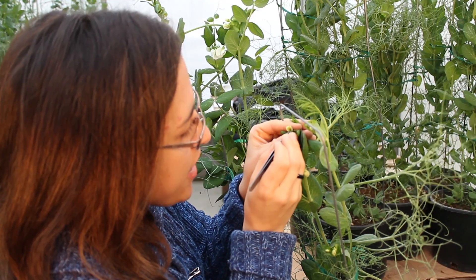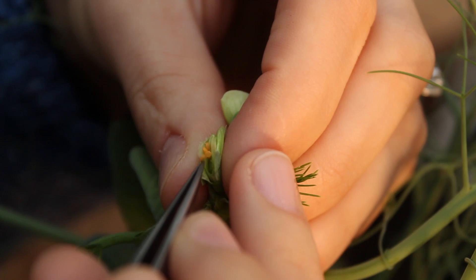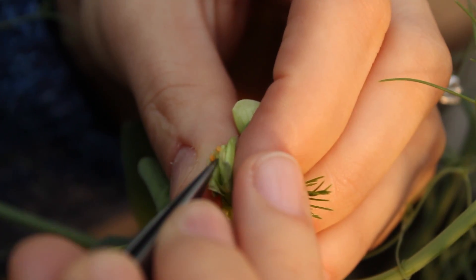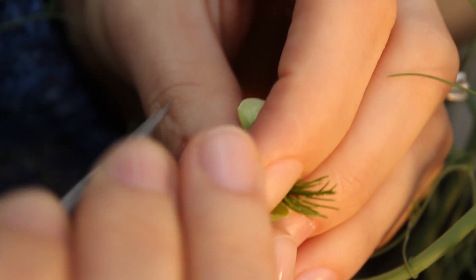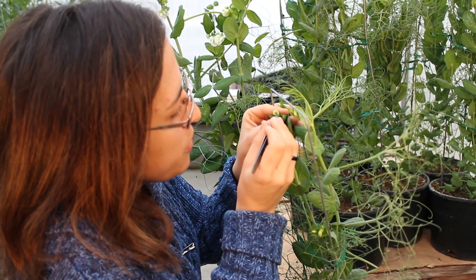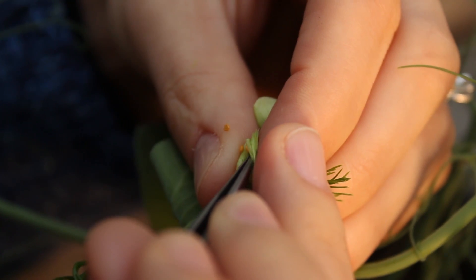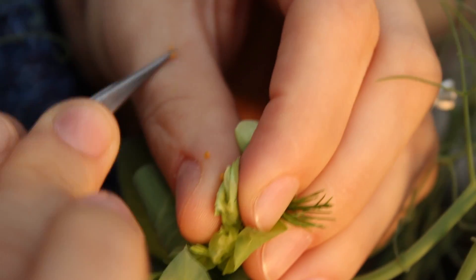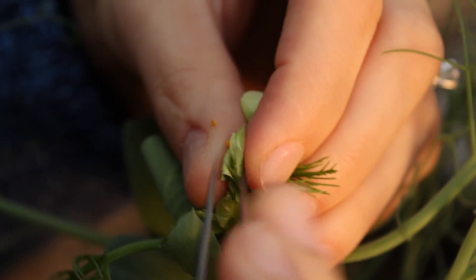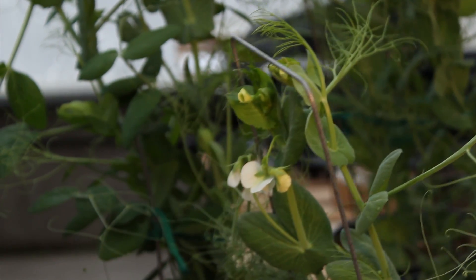Those are anthers and they have pollen. So I'm going to go ahead and remove all the male parts, all the anthers. And I'm only going to leave the ovary behind and the stigma, because that's the female part I'm interested in. So this is my female plant.